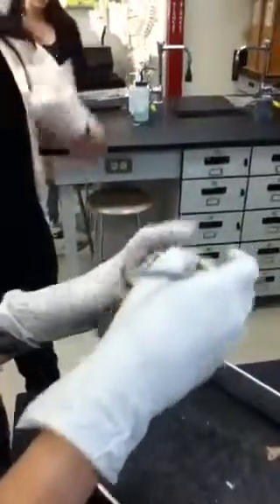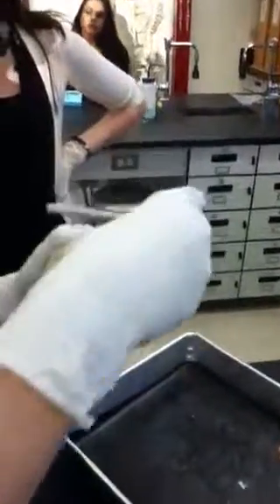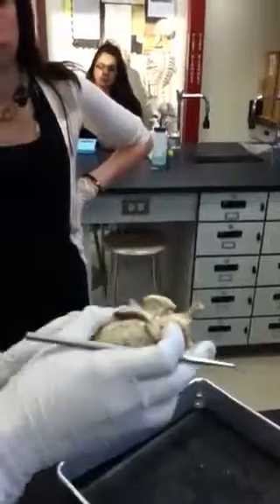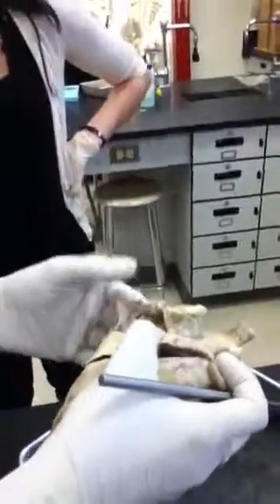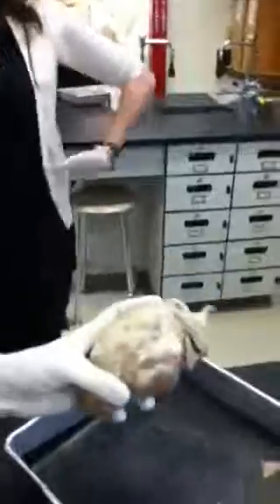And I think that's it. Make sure you are able to identify, when you're looking into atria, the way that the muscle looks inside the atrial wall. This up here is called pectinate muscle. So it kind of looks like a comb. All right. That's it.